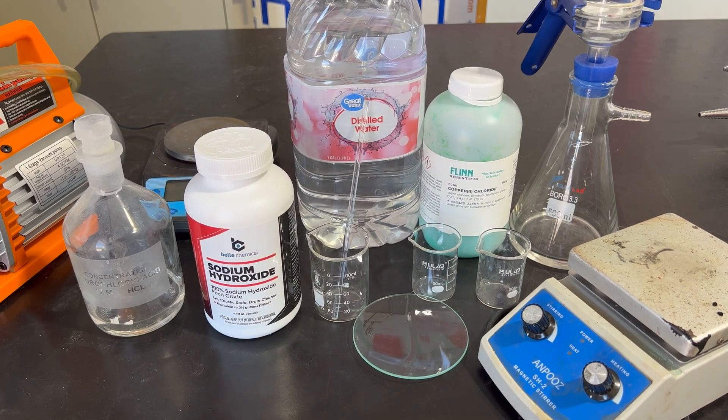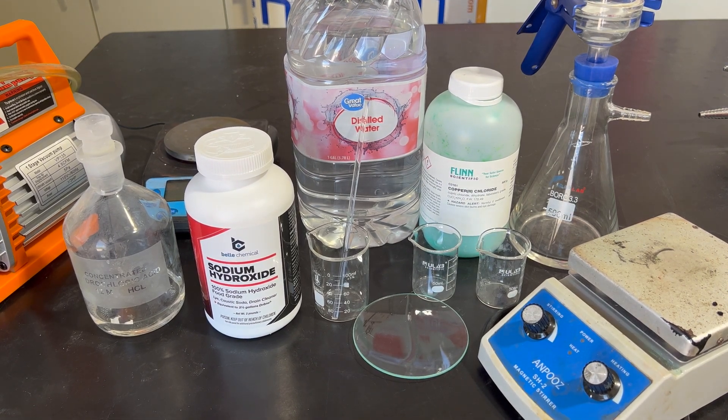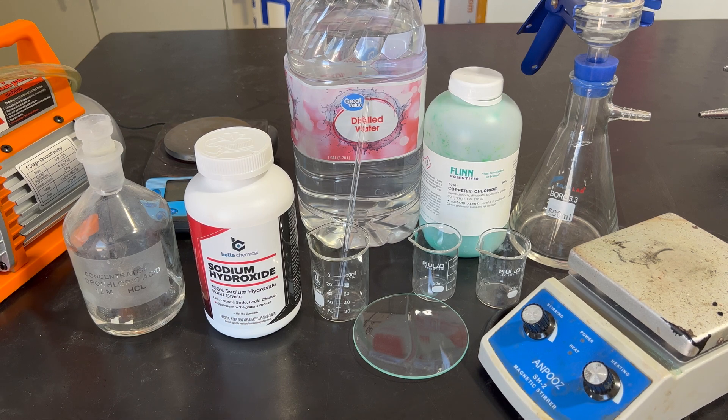Anyway, let's get into the video. Today we're synthesizing copper oxide from copper chloride and sodium hydroxide, then converting it back into copper chloride.